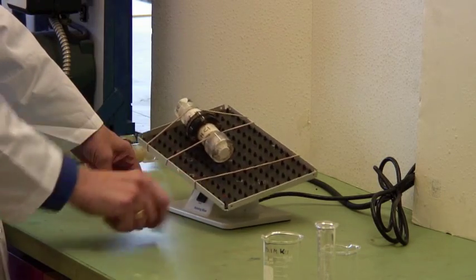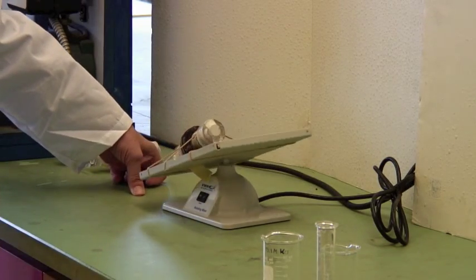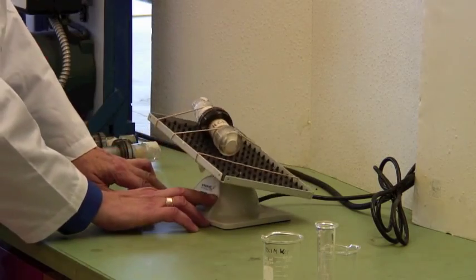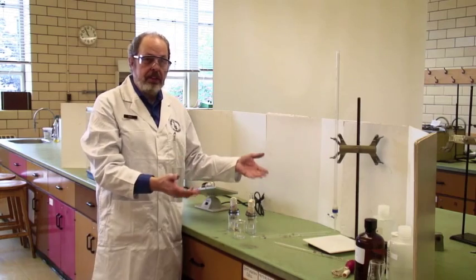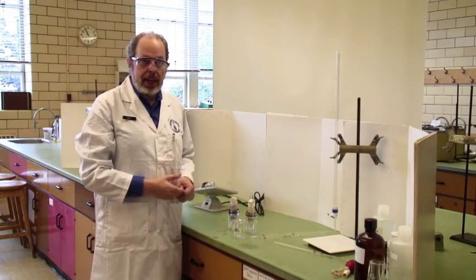If you're really getting bored, you can push on one corner. It'll go the other way, but it doesn't make any difference. You will do that conditioning a couple of times, and when you are finished with that, you just discard the salt solution and acid.